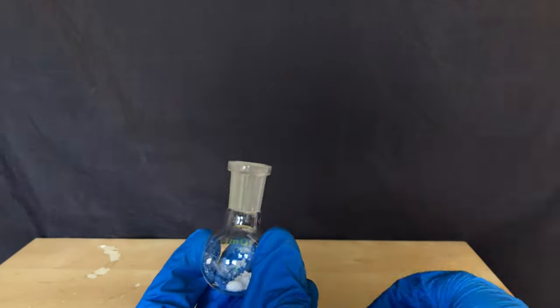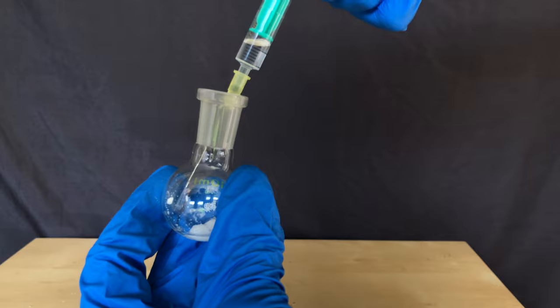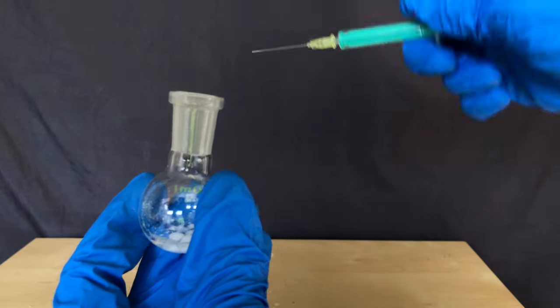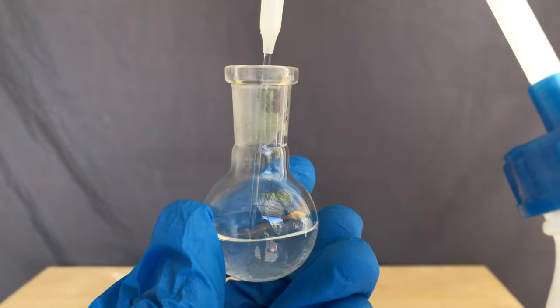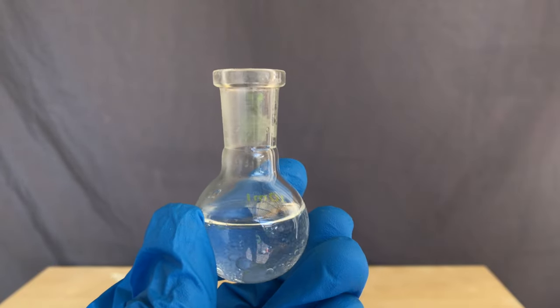To make the ester all one has to do is to add the acetyl chloride to the isoborneol and to swirl it around. In the end we were left with this clear liquid and I decided to add distilled water to react with leftover acetyl chloride.